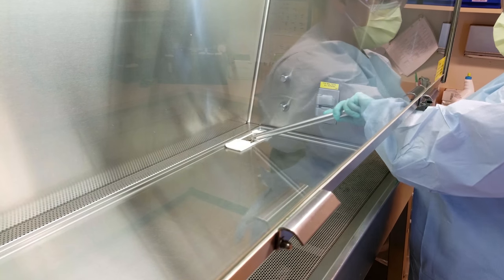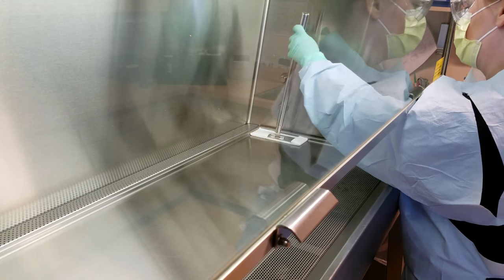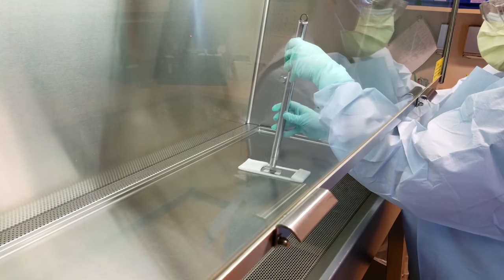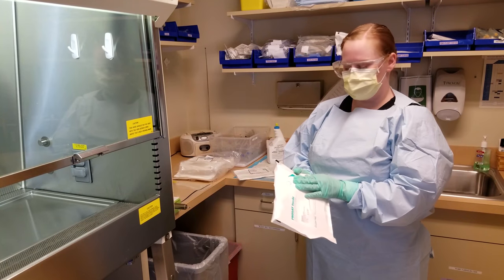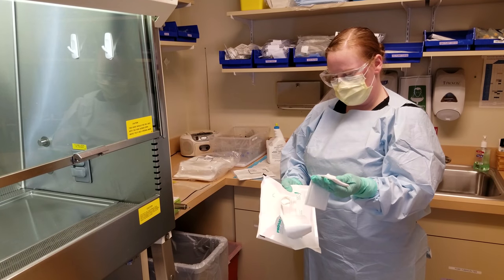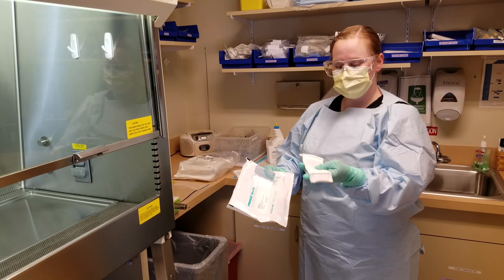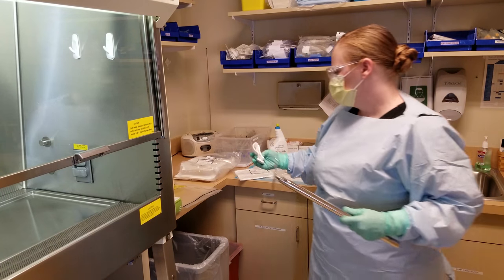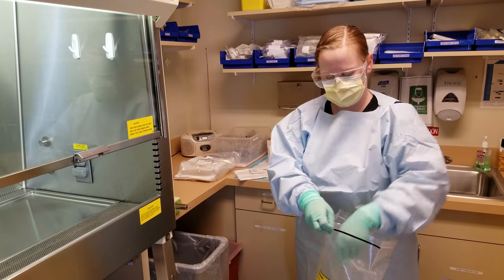After this second step, allow three minutes of dry time. This three-minute dry time starts from the moment the pad touches the top of the hood. Discard the used cleaning pad and grab a pre-saturated alcohol pad to place on the reaching tool. Wipe down the hood in the same fashion as described in steps one and two. This is the third and final step of the daily hood cleaning procedure. Place used pads and wipes in a sealable bag and dispose of as chemo-trace waste.